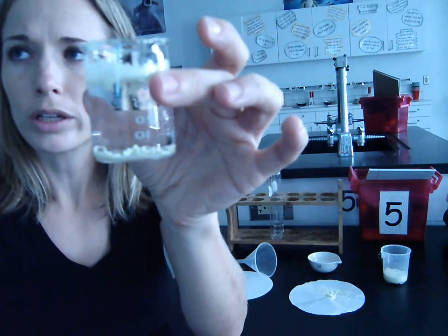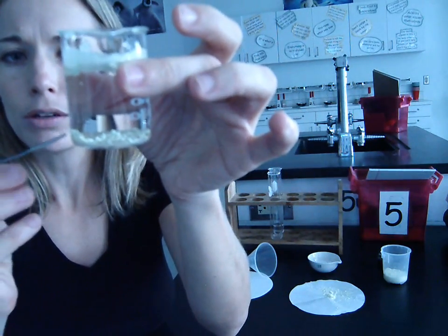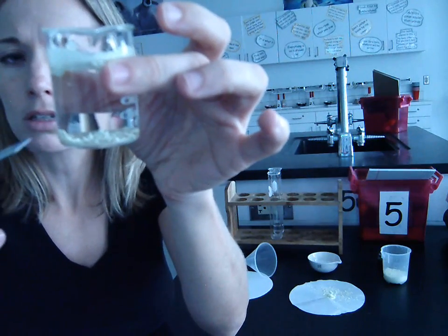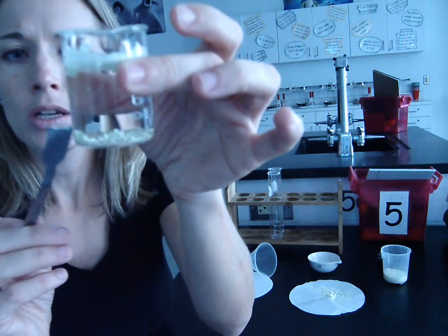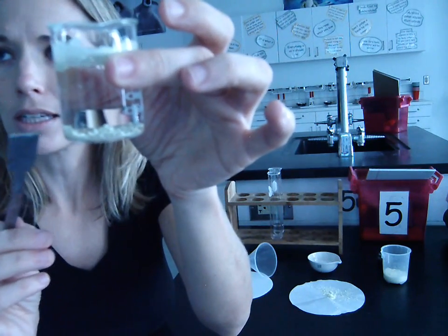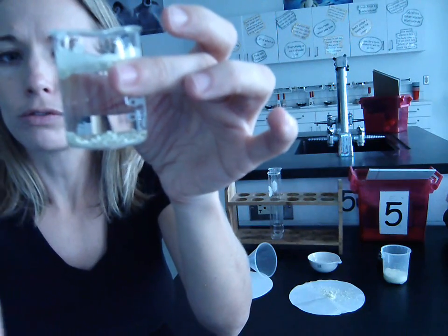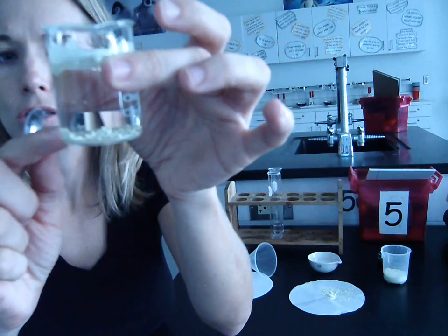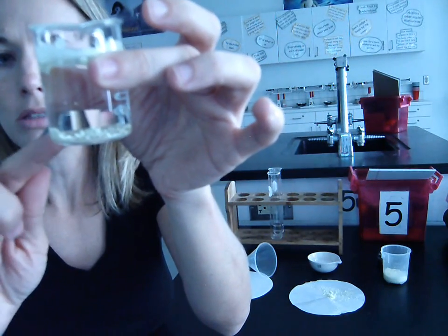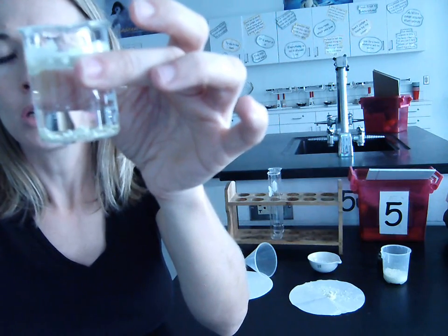Now, you might be wondering, there is a little bit of sulfur that has sunk to the bottom, and the only reason we see that is because when I mixed it up, some of the sulfur and sand is sticking together, and because the sand is more dense, it is actually physically pulling the sulfur down. So the only reason you see sulfur at all on the bottom is because it's mixed with the sand, and I haven't been able to get them to separate.